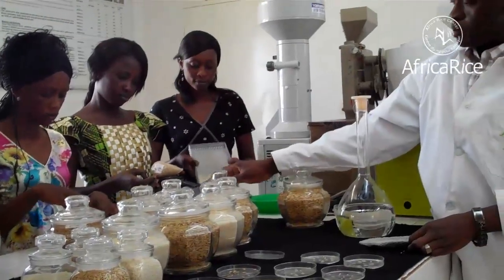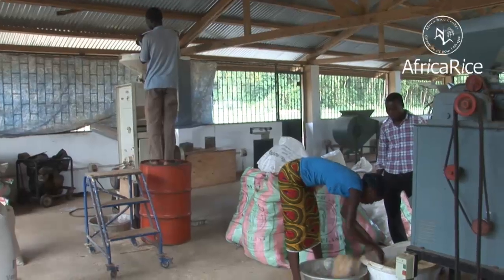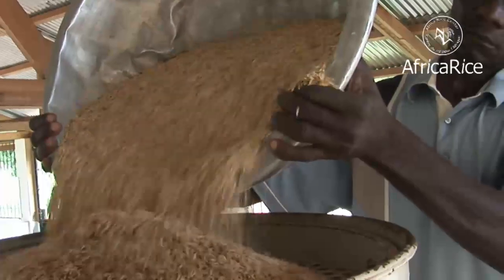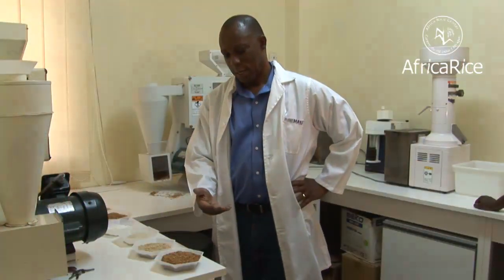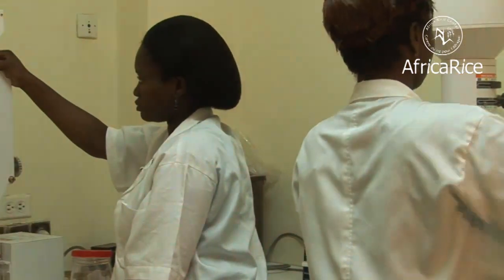The Grain Quality Lab simulates to some degree the functions of a commercial mill. A commercial rice mill usually consists of three main units: the dehusker, which removes the husk; the polisher or whitener, which removes the bran; and the grader, which separates brokens from whole grains. In a lab setting, however, these units are separated to enable the systematic evaluation of paddy grains as they go through the milling process.